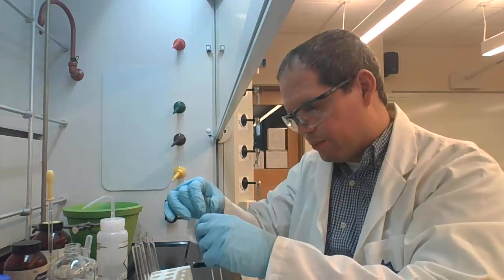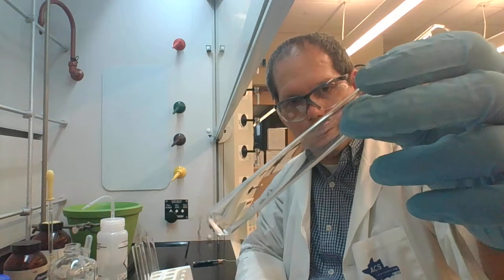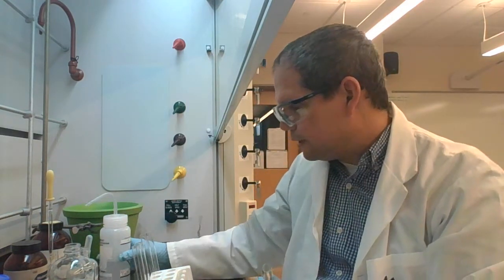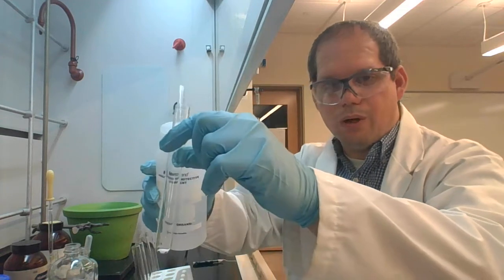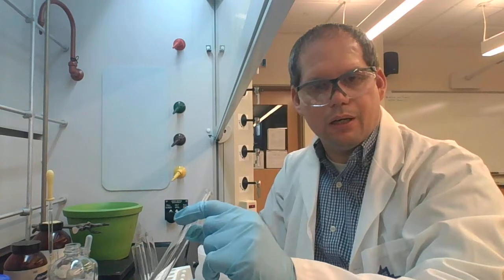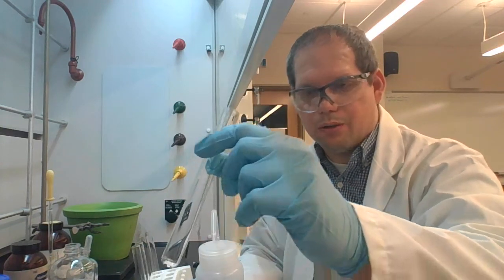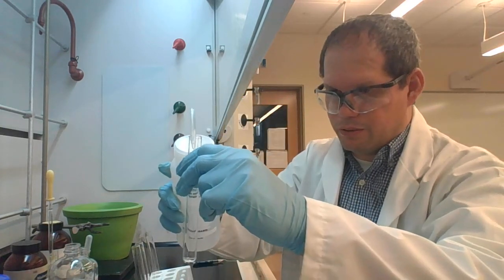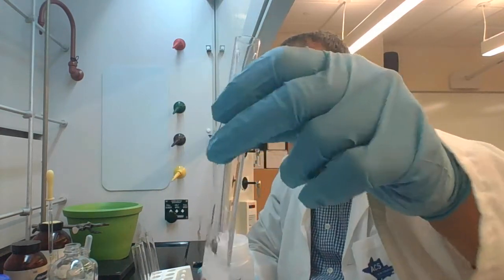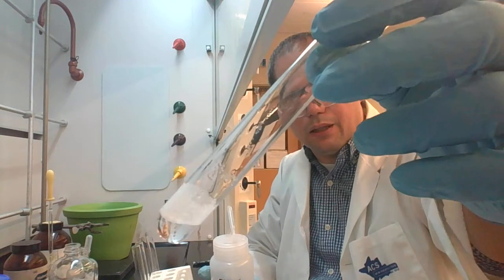Okay, so last up with fluorene, test tube 3, again 50 milligrams. We want to add to it about 1 milliliter of water. We already have seen what 1 milliliter of water looks like in one of these test tubes, so we're going to shoot for that. And when we add the 2, you can clearly see that the 2 are not soluble.